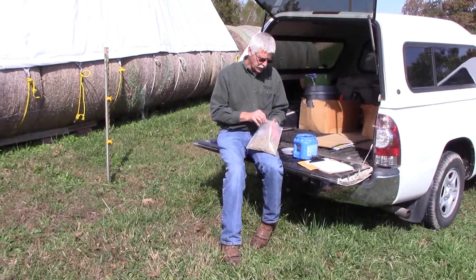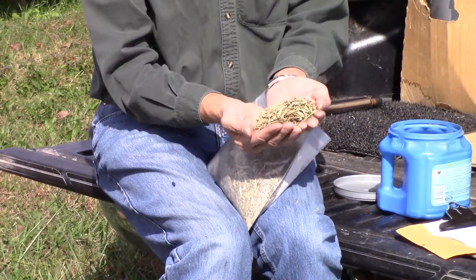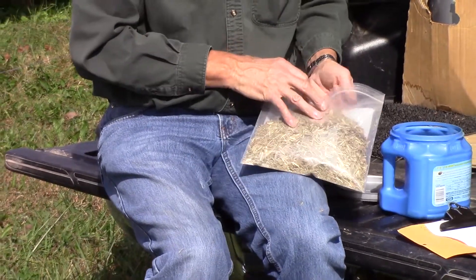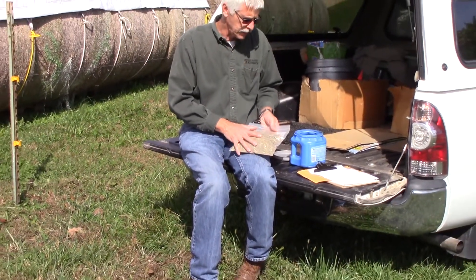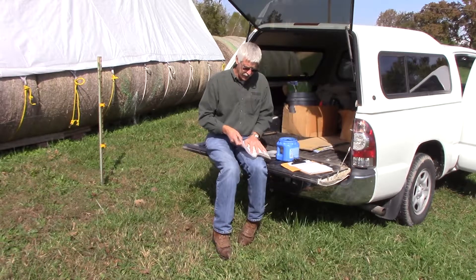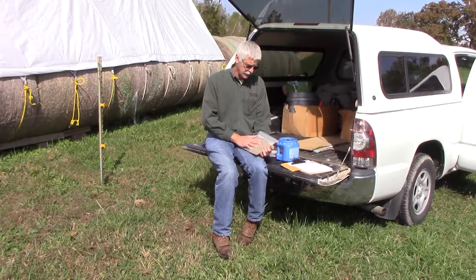As you zoom into the bag, I'll pull just a little bit out so you can see the length of cut on the particular hay we've got here, then put that back in the bag. You can also see collections of fines in the bag that will contribute to the overall quality of the forage sample. We simply try to seal the bag as best we can. I like to squeeze out a bit of air — it's not all that critical, but I got in the habit of doing that. Then we seal it up and we have our sample ready to go.